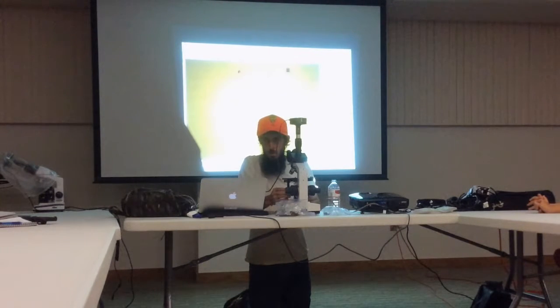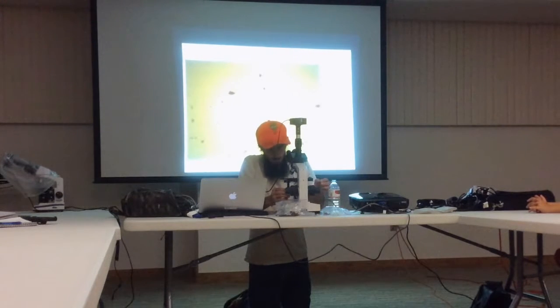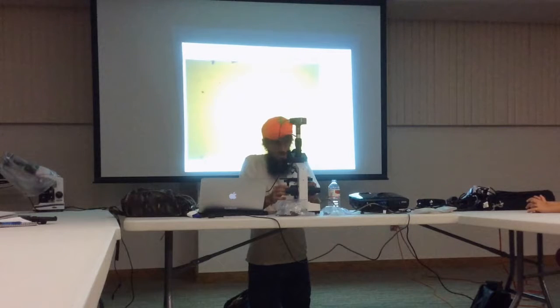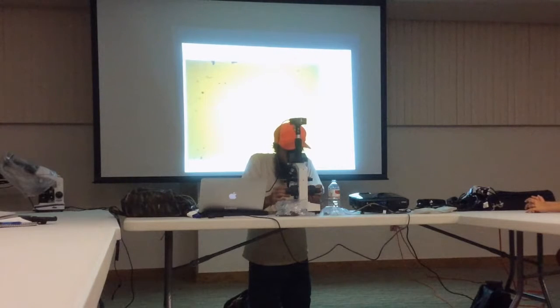Okay, so first thing first, when you get a new slide and you put it in, you can scan through, which I kind of reduced the light here for me to see anything. Can you still see it there? So first thing first is I scan the slide just to look for nematodes at 40 times.